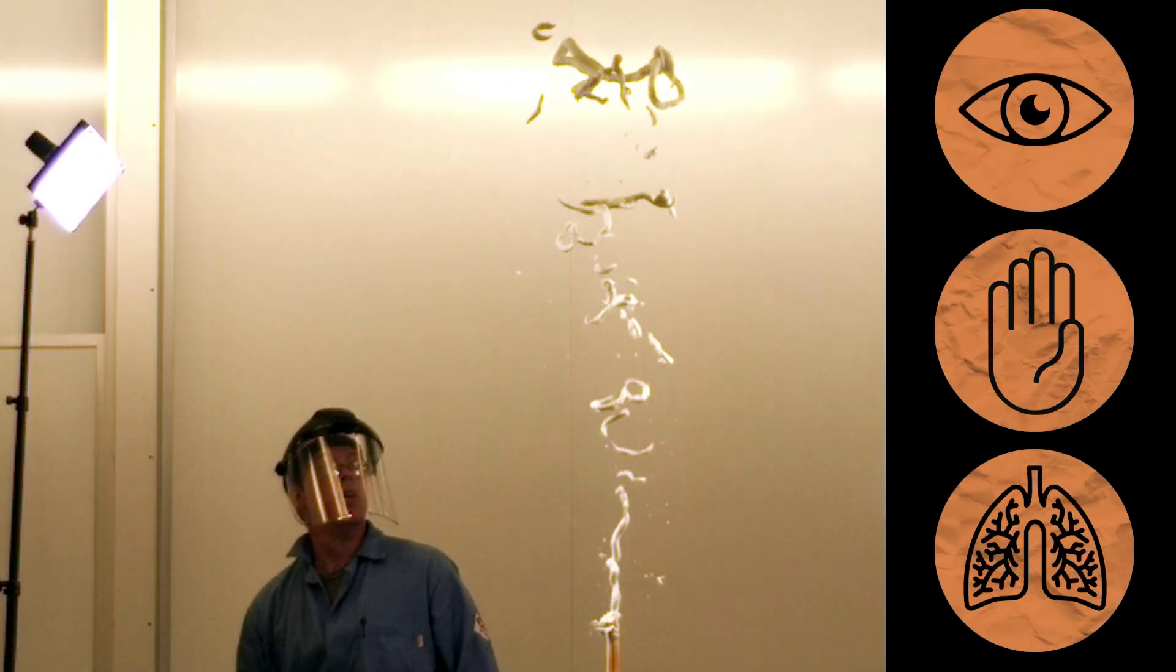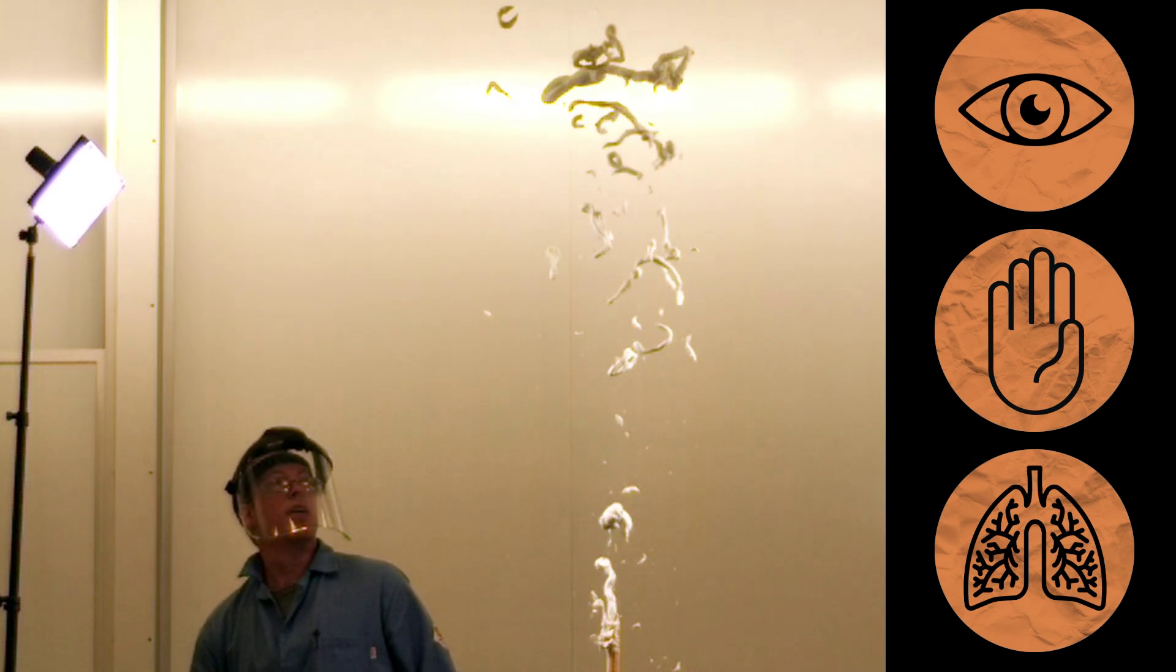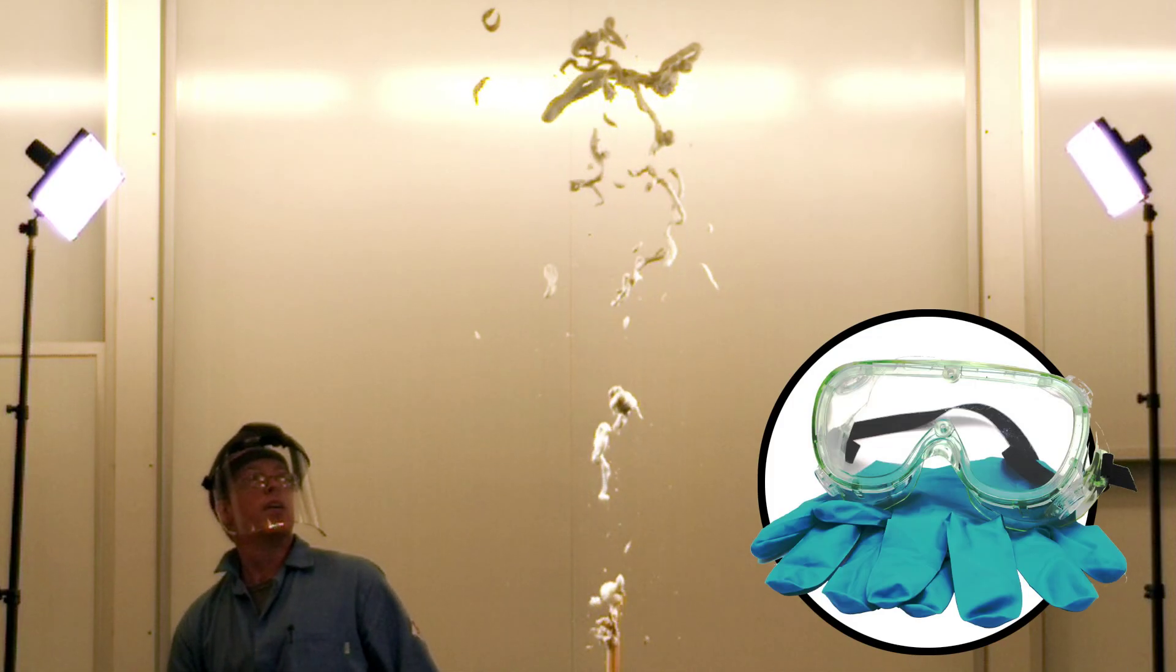Hydrogen peroxide is corrosive to the eyes, skin, and lungs, especially the 30% mix we're using here. Always use gloves and goggles.